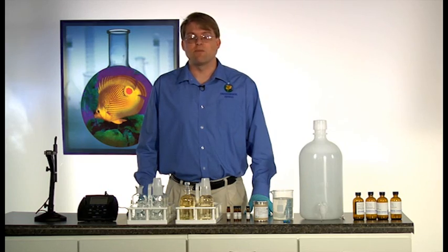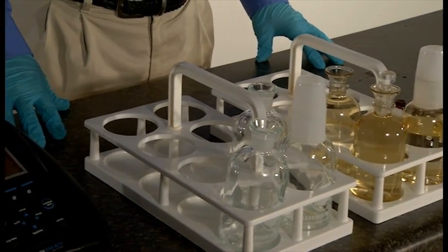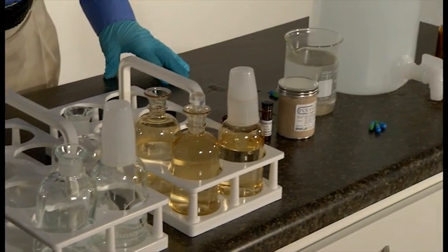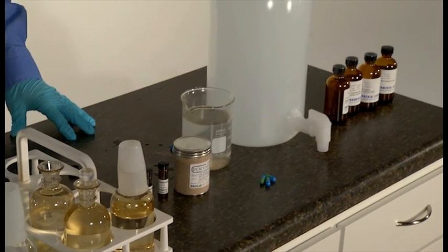Chlorine, if present, needs to be neutralized with sodium sulfite. Each sample needs to have several dilutions prepared to ensure an appropriate BOD value.